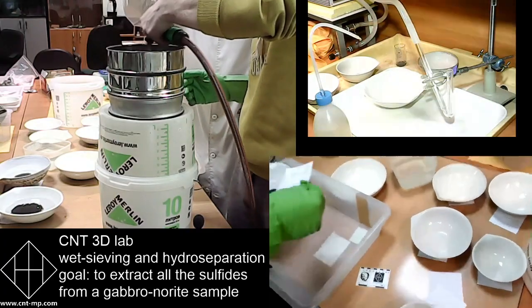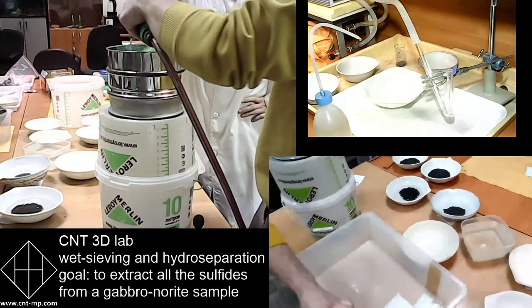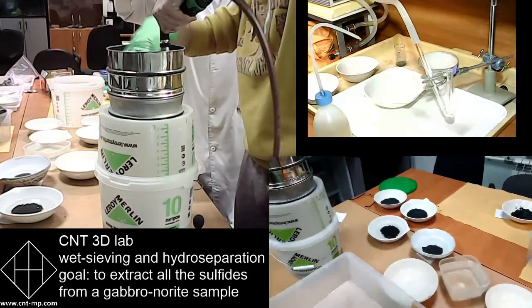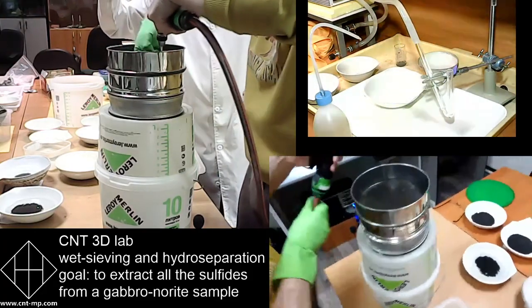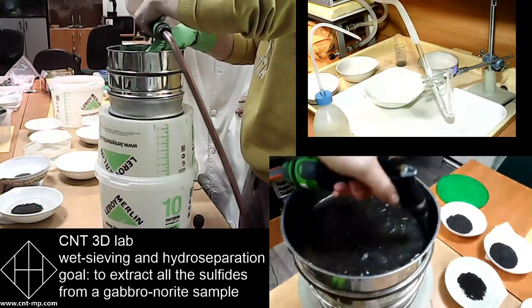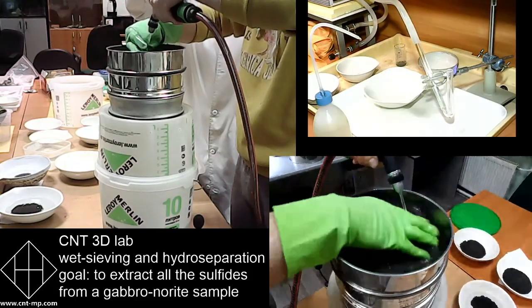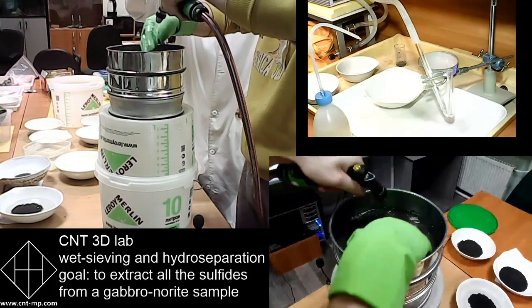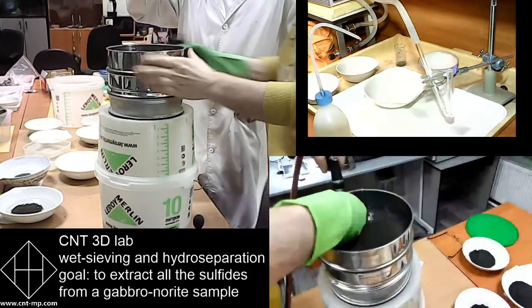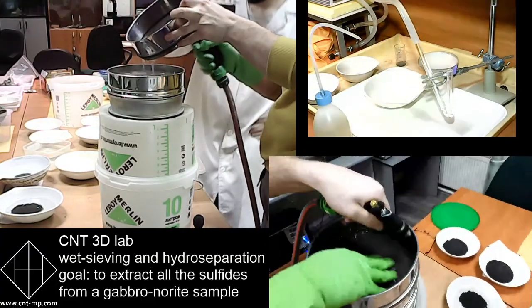Sometimes you get much more sample, and you can see that immediately he makes a little tag for the specific size fraction, simply because to remember anything, there is a tag under each dish. So we use these wide mouth beakers, these dishes, that are very handy. They're wide enough to host enough material, and also it's very well organized in terms of space with his dishes.